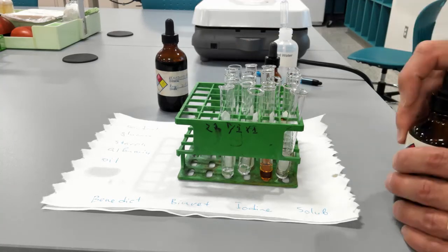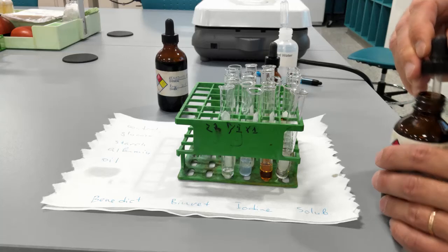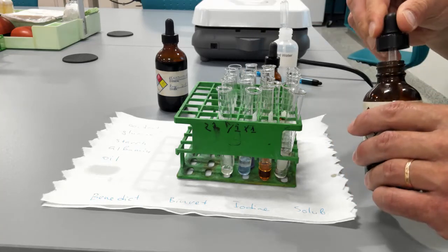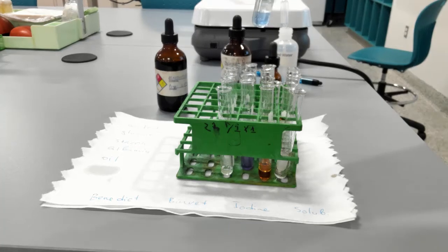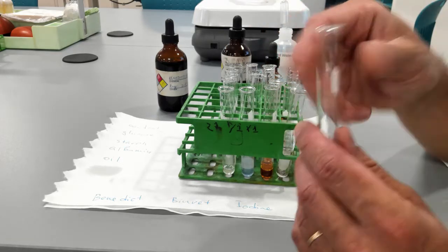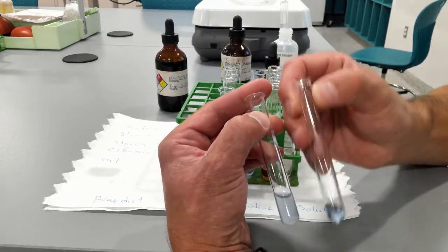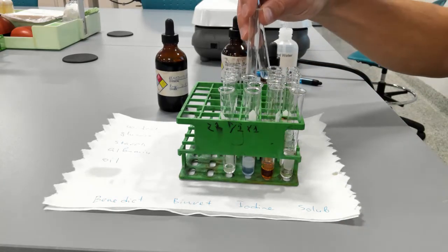So next we're going to use Biuret reagent. I'm going to add a dropper full of Biuret to each tube. Again, this is a water-based solution, so you can easily imagine corn oil is not going to mix. It stays on top. And then we have albumin, and we clearly see the color change compared to the control. So this is the control, this is albumin with Biuret. And nothing really changes compared to the control in starch and glucose. Basically, it just gets a little bit diluted.